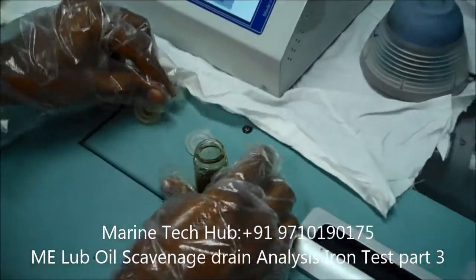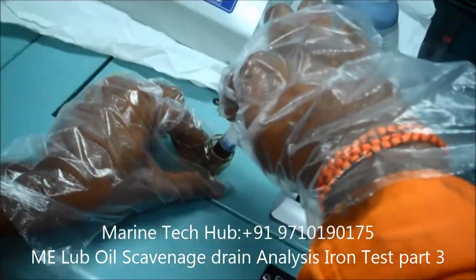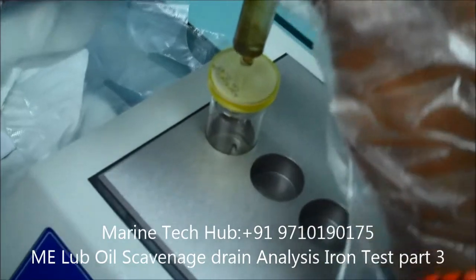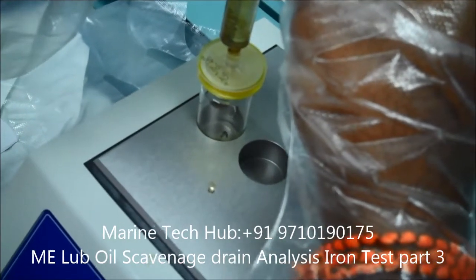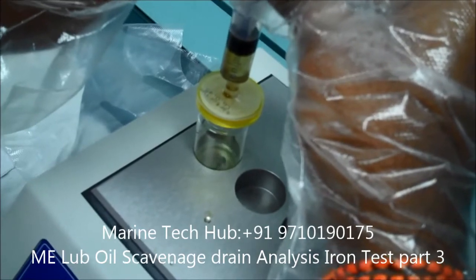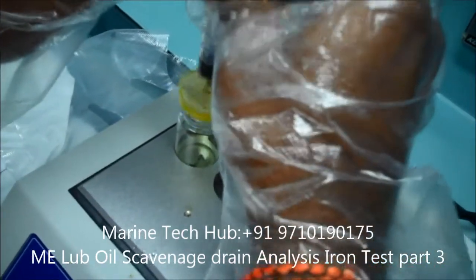The next step is to take 5 ml from this mixture using the same syringe and inject 4 ml into oil number 1 through the filter. It means leave 1 ml in the syringe. The remaining 4 ml will go in the oil. So 4 ml is already in the oil.